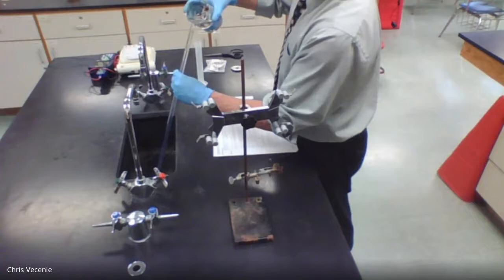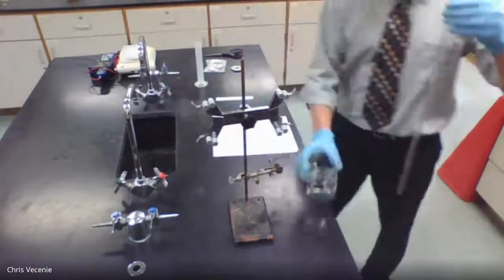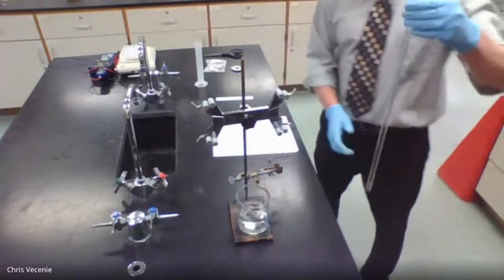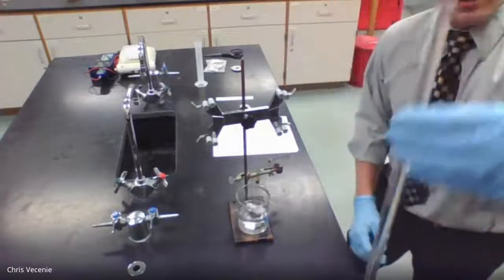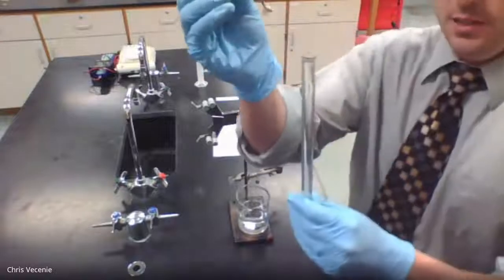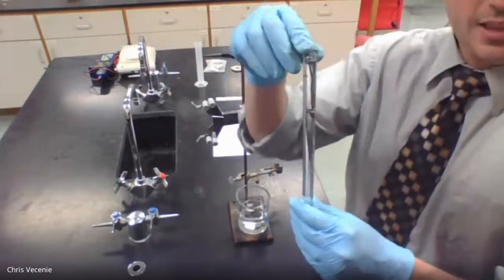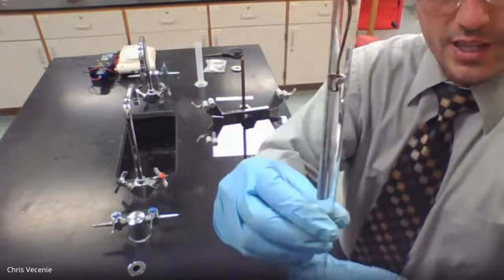And so our whole tube's filled to the top with the water now. So now I've got water in here and acid. All right, now I'm going to take my ribbon with my magnesium. I'm going to insert it like this. So now you can see it's in there.